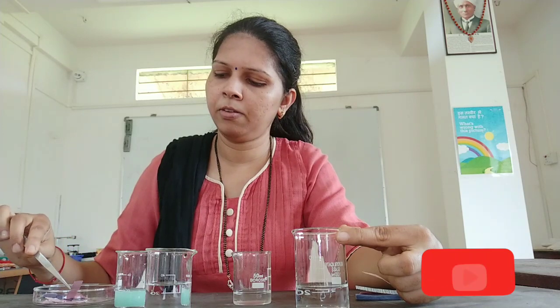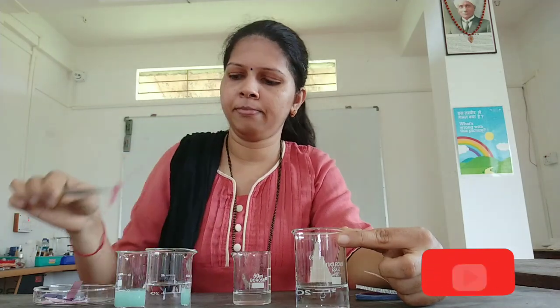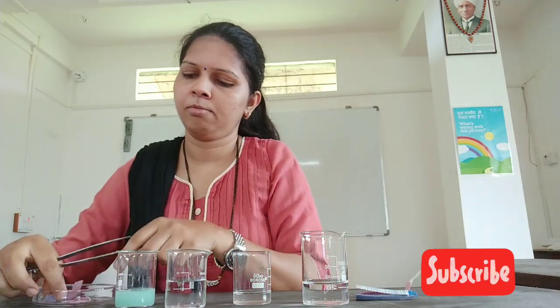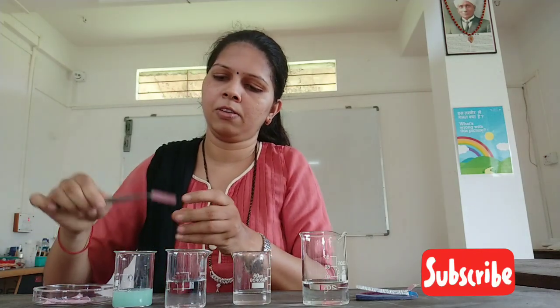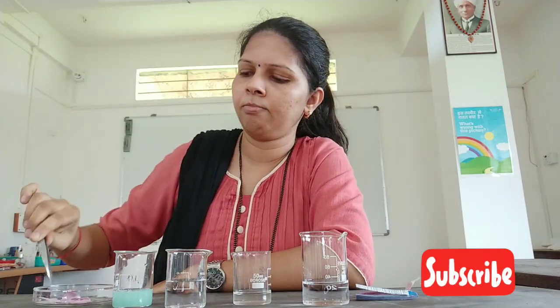Now let us perform the same activity by changing the color of the litmus paper. This time we will take the red litmus paper and try to find out the nature of these solutions. I will take the red litmus paper and dip it in the first beaker. There is no color change — it remains red only.